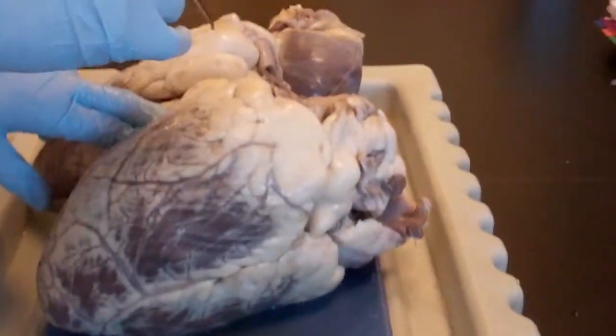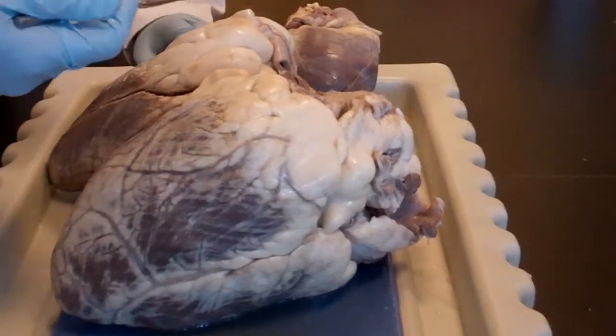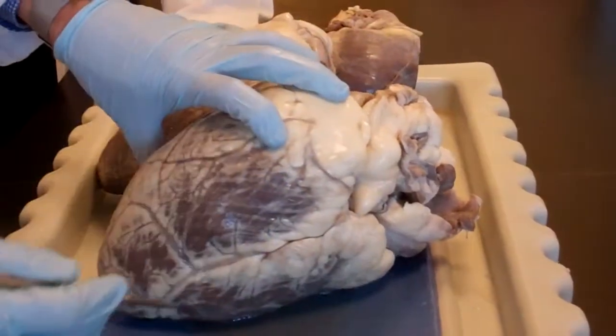As long as you know that this is a coronary, you don't have to tell me here's the artery, here's the vein. It's not important. As long as you understand that the coronary is in this area. But if you tell me that's coronary, well, God knows, right?